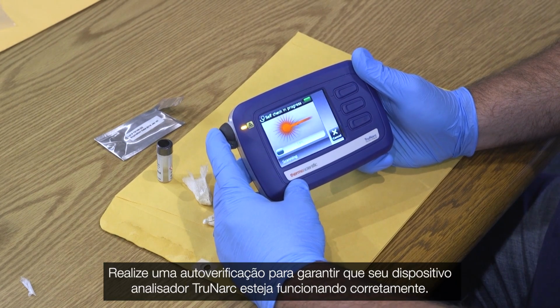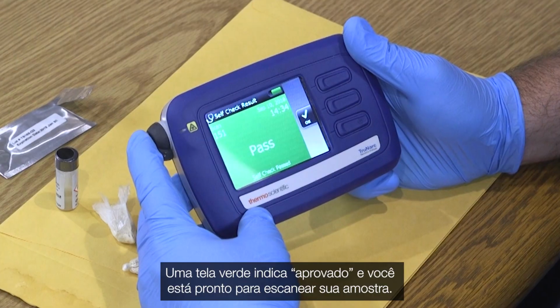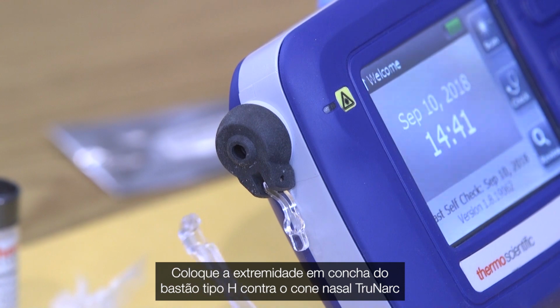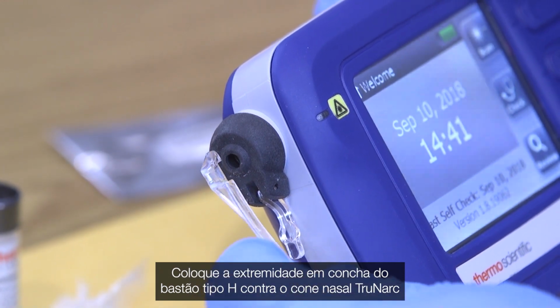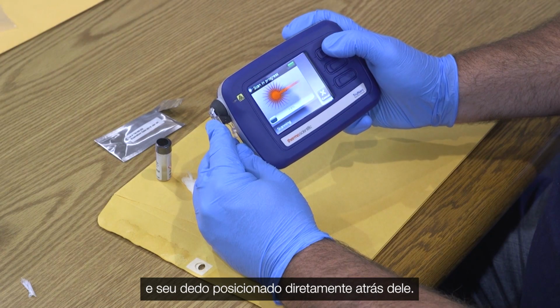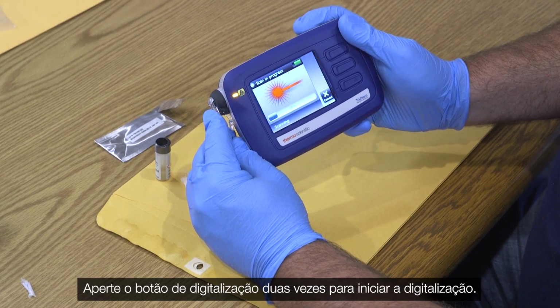Perform a self-check to ensure your Trunarc analyzer device is working properly. A green screen indicates pass and you are ready to scan your sample. Place the scoop end of the Type H stick against the Trunarc nose cone with the dried substance directly in front of the laser and your finger positioned directly behind it. Hit the scan button twice to initiate the scan.